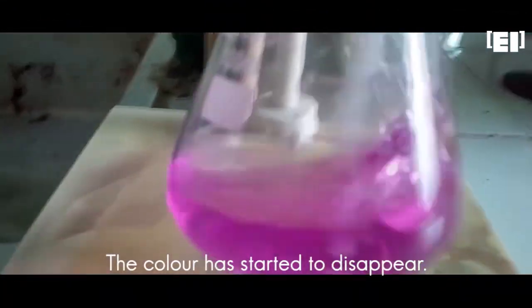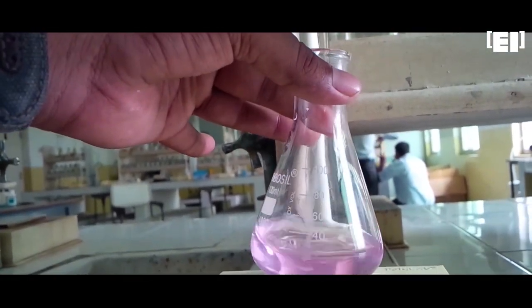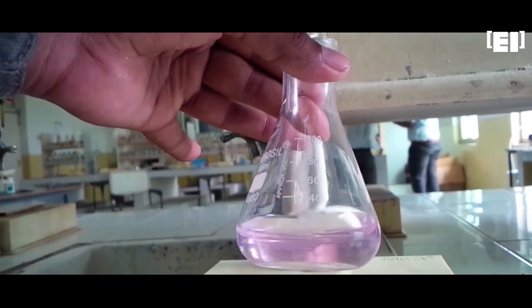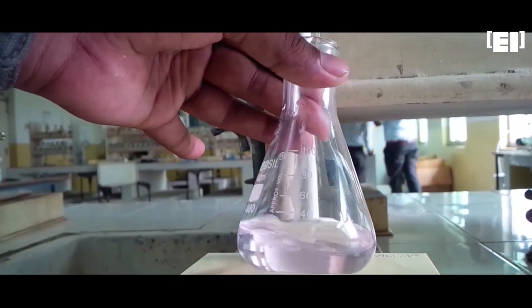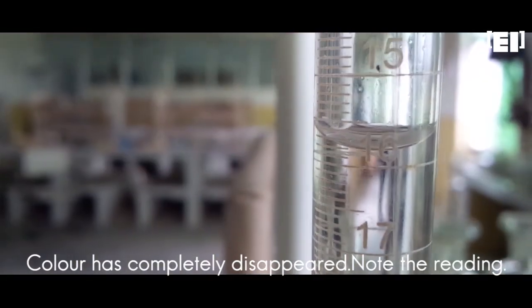The color has started to disappear. We are approaching the end point of this titration. The color has completely disappeared. Note the reading.